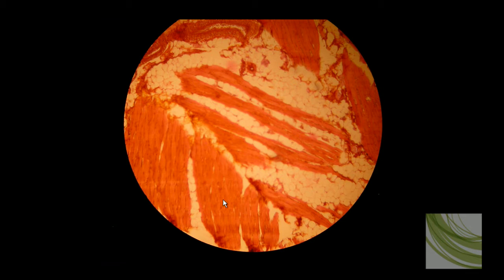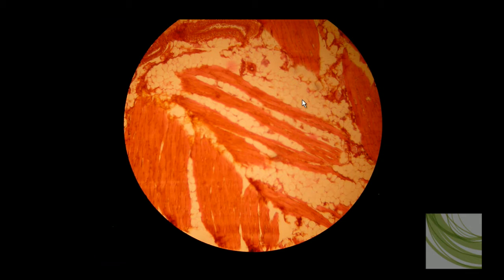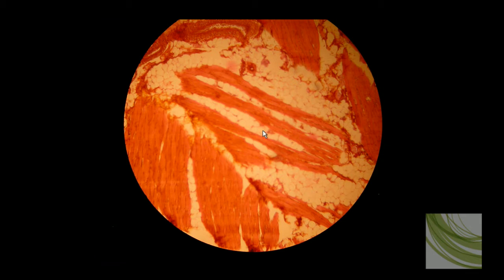Here is the same slide using the 10X objective and we can see skeletal muscle in this region, this region, and along in here. This is obviously a very well-fed individual — we can see all the adipose tissue scattered around. We still don't see the bands all that efficiently, but they're there.